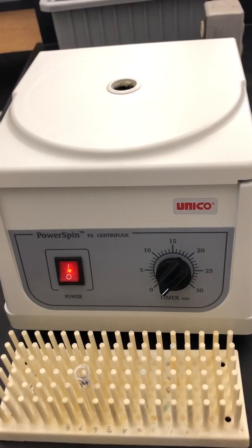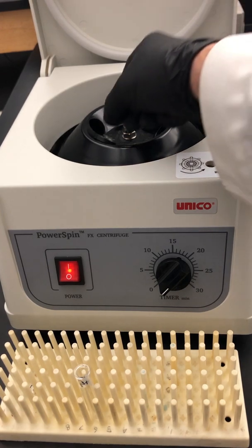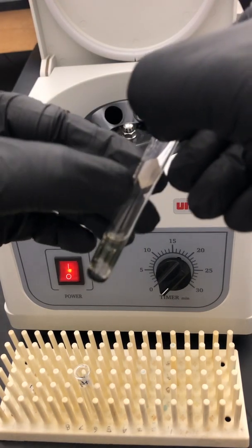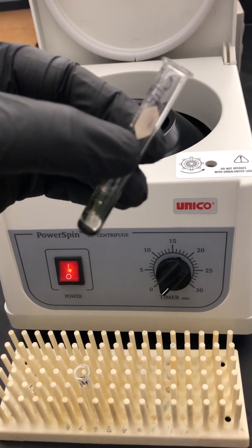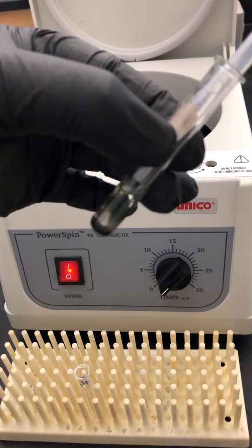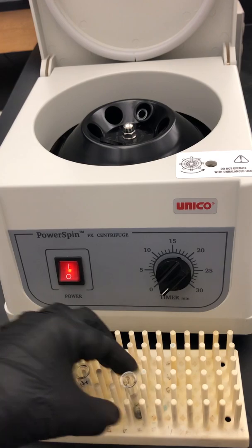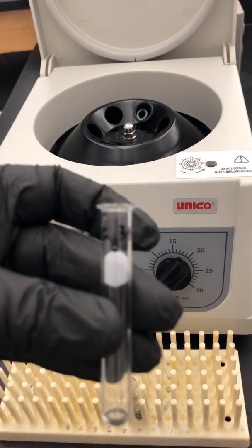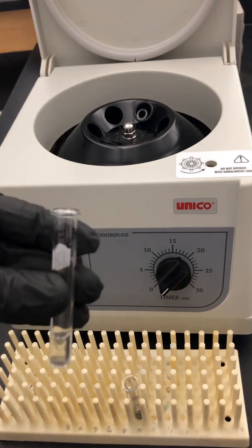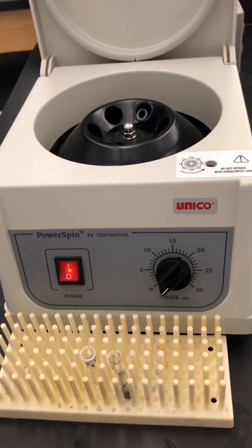Students, we're back here at the centrifuge. Our spin has finished. We're going to open it and very carefully take out our test tube of the copper sulfide precipitate. As you can see, it'll have a very tight pellet in there. Very carefully, I want to decant it — going down the middle, not down the sides, and very carefully removing the supernatant. This time I'm going to decant it into a test tube that I've labeled iron III, because I expect this to contain iron III ions.